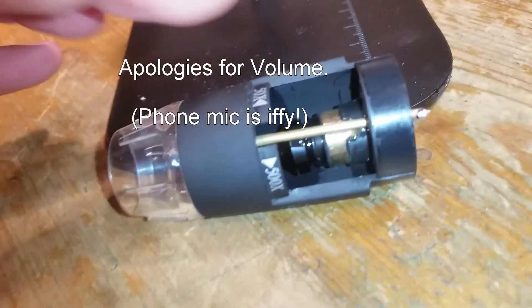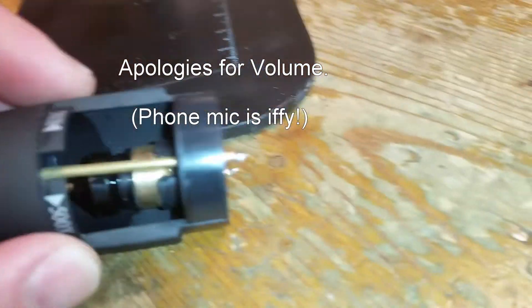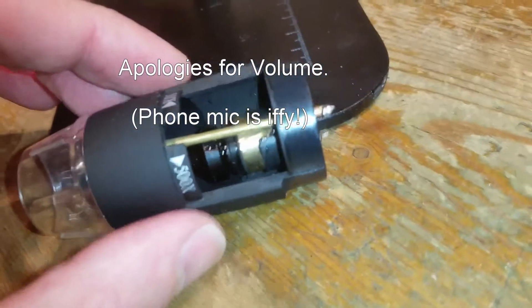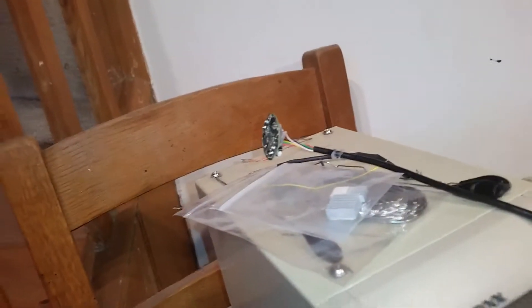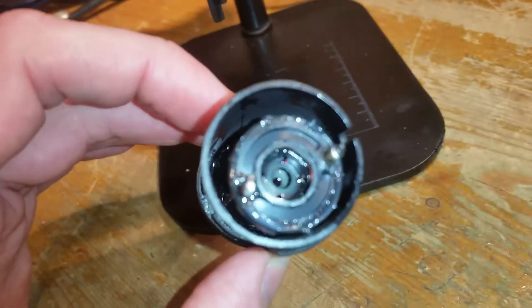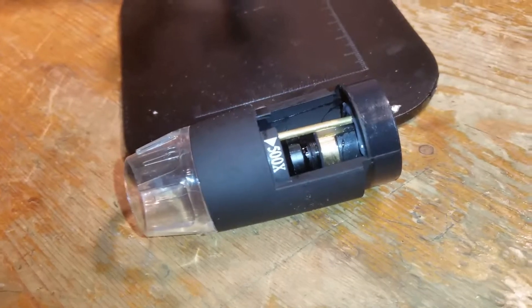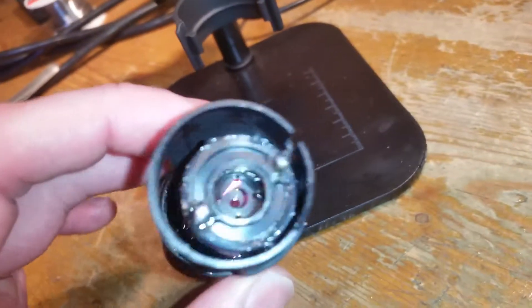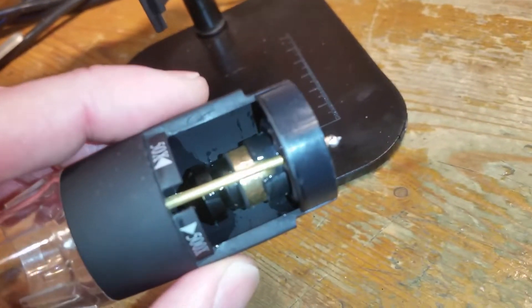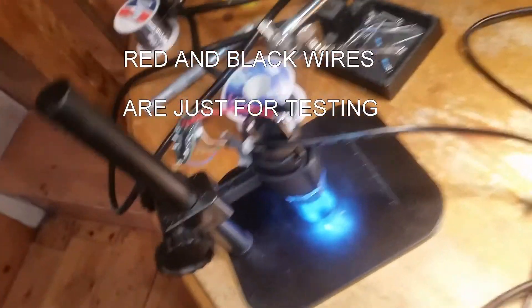Just revisiting this because the light didn't work - the dimmer. Pulled the board off on the sides of those, and then pulling this up - it's covered in grease. That section comes out, then that section comes out. I'm going to get back to the LEDs and remake the connections. Basically these two bits of tube are what's conducting down to the LEDs. So that's the dimmer fixed.